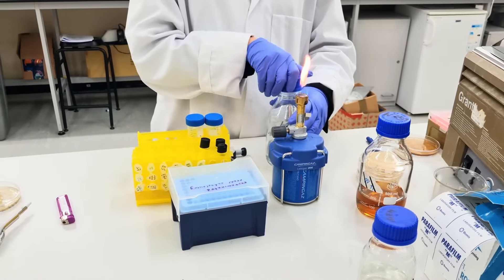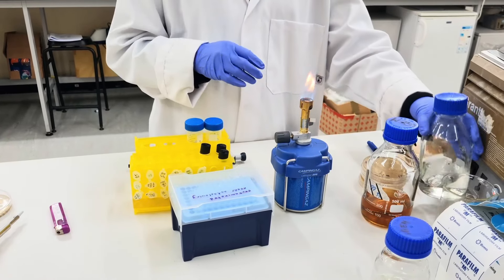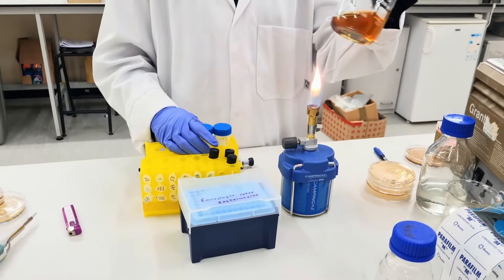This way we can avoid cross-contamination during the experiment steps to avoid contamination of the original medium bottle.